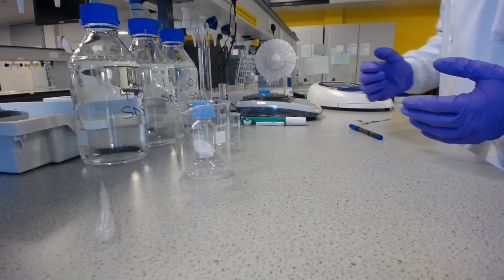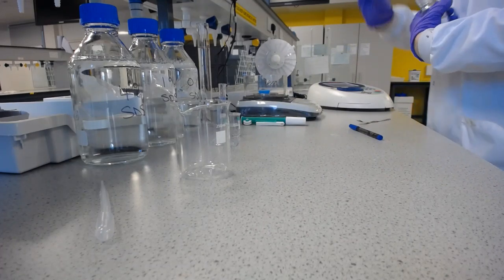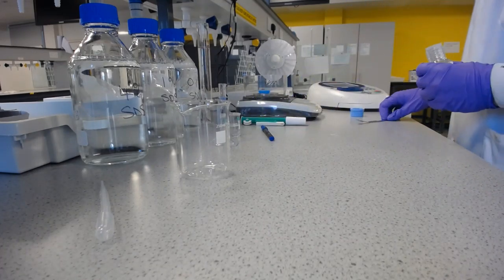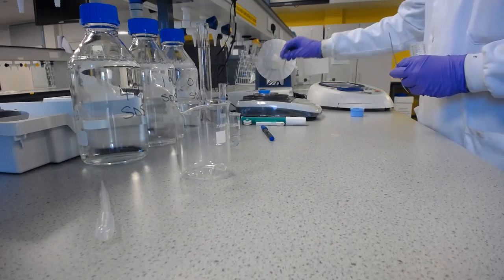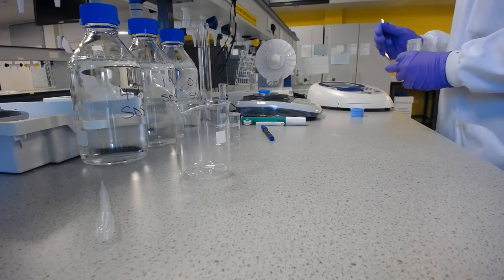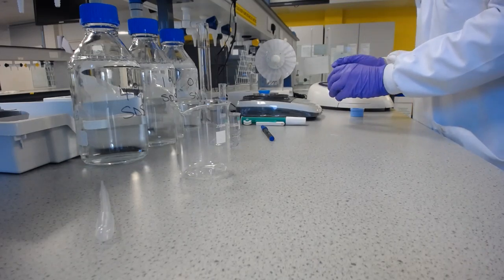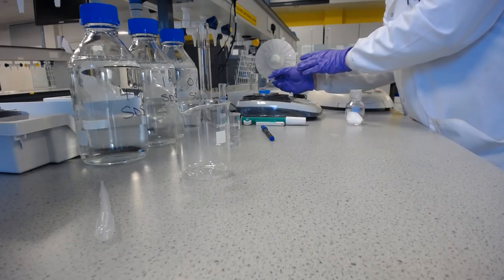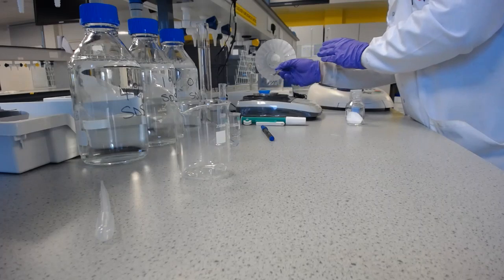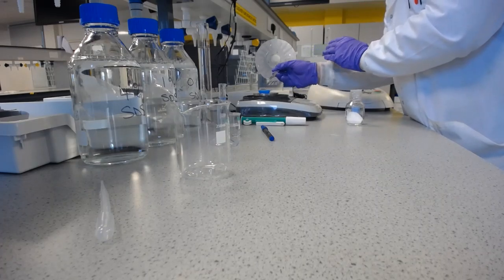So the most concentrated solution is 80 milligrams per litre, and we're going to make 100 millilitres, so we need to weigh out 8 milligrams. Now, I've previously tared this. I would put it straight into the beaker, but we're really at the limits of what this balance can actually do. And so I need to make sure that I'm not overloading the balance with the beaker so it can accurately weigh down to 8 milligrams.